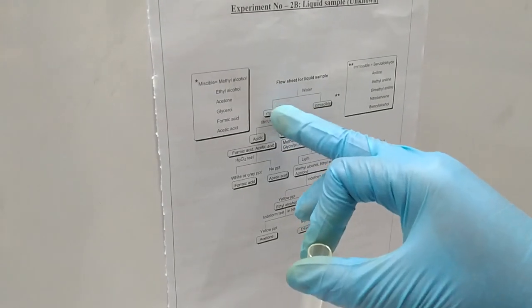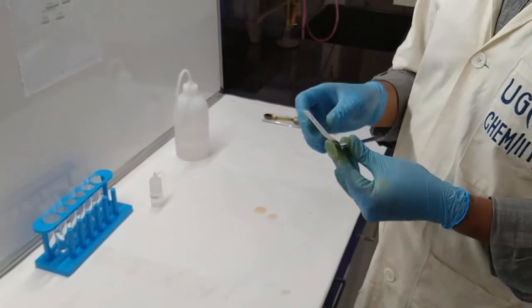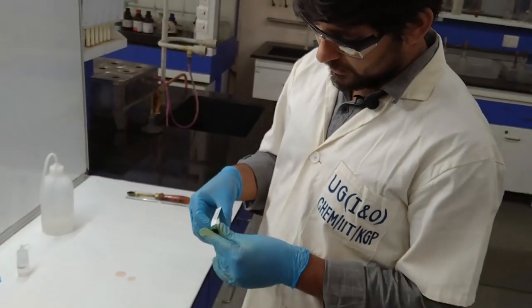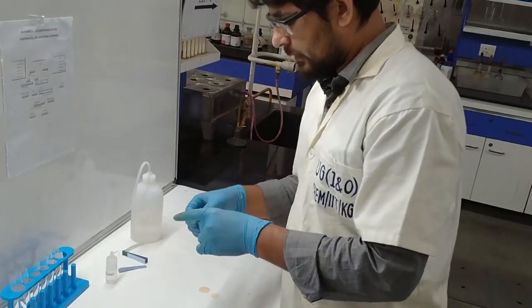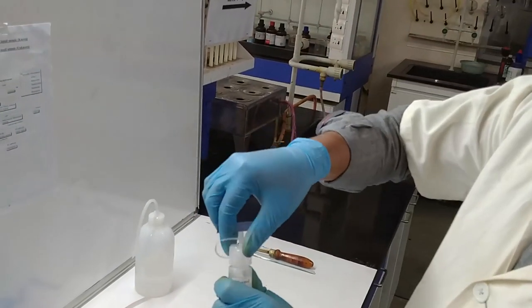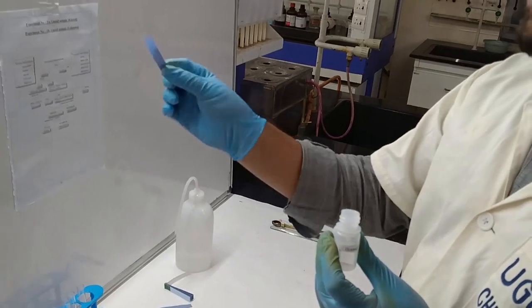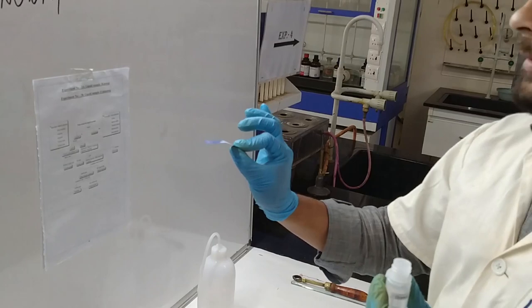Now, what do we have to do? We have to follow the flow chart — the litmus paper test. As the sample is miscible, we have to perform the litmus paper test. For that, we have to take a blue litmus paper and put it directly inside the sample container. No changes. That means this is a neutral solution.